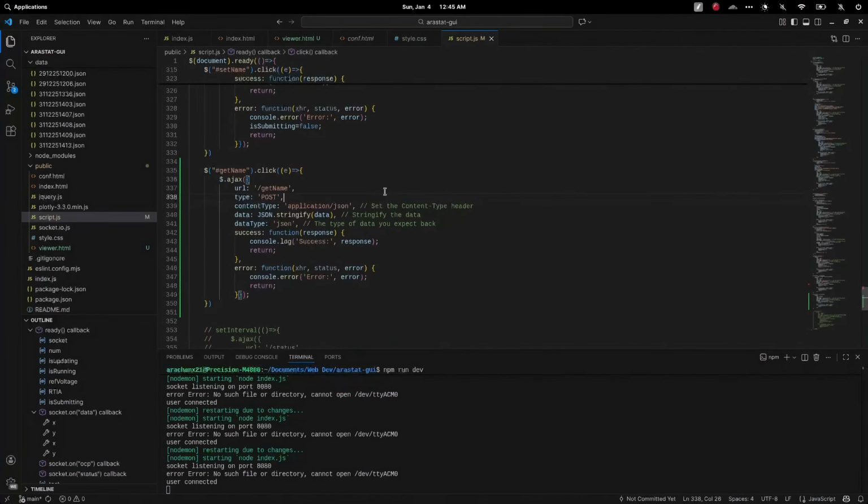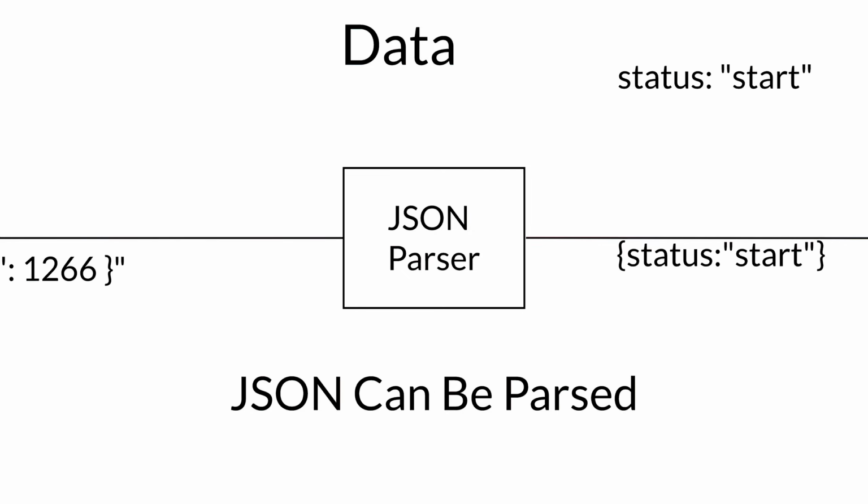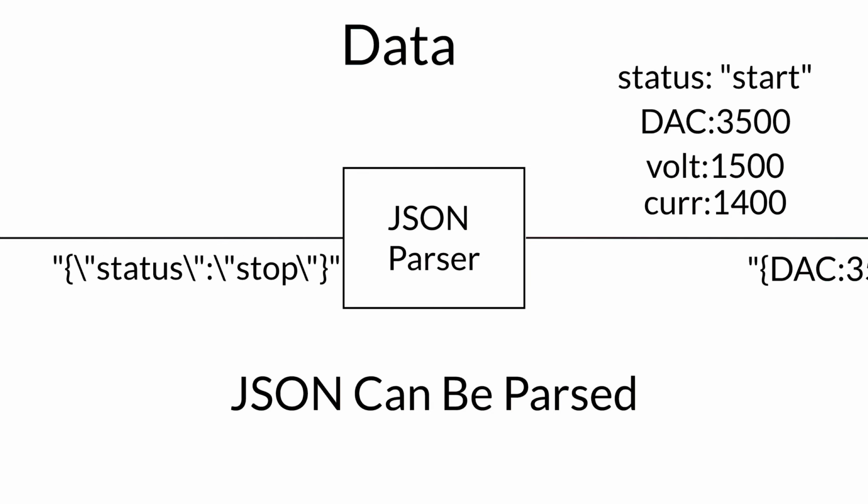In the backend, the server checks whether the incoming data can be parsed as JSON. The server ignores data that isn't JSON, but it parses the data that is. The data can be parsed to determine the state of the device. For example, if the state is start, the app would plot the measurement data, or else it would just show the data on the dashboard.